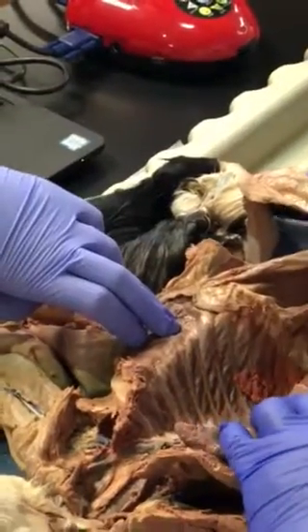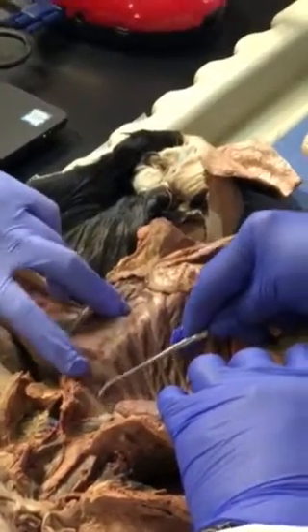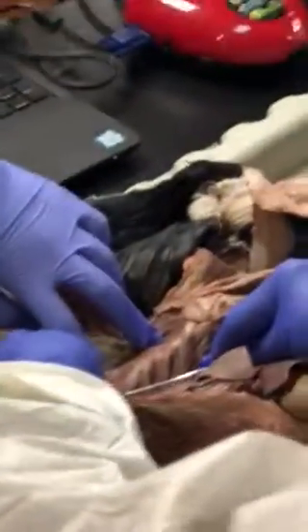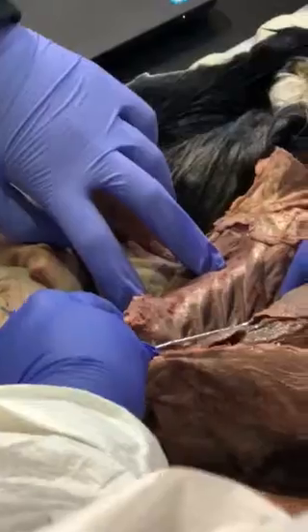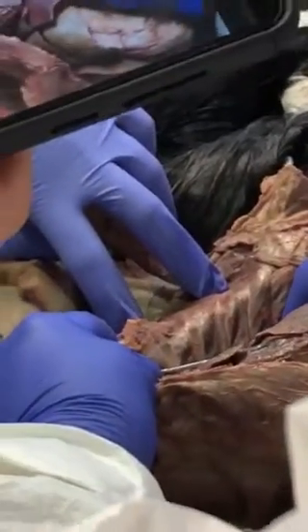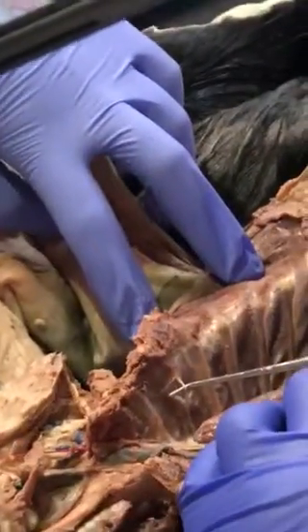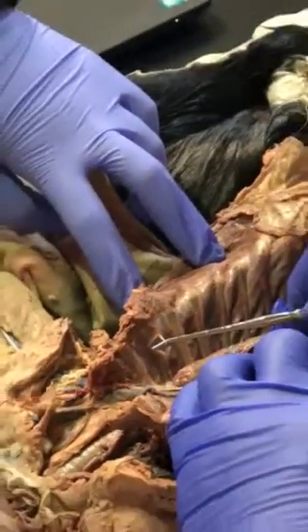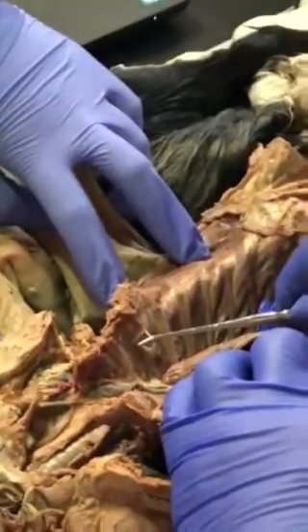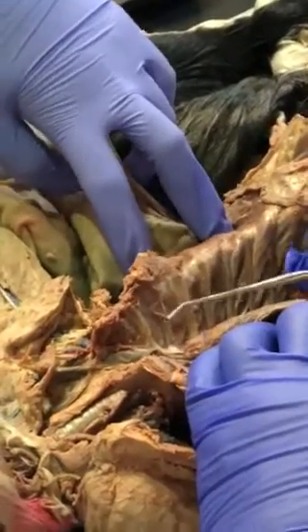Now, there will be a question here. You see this white thread-like structure here? What do you call that? It's not an artery, it's not a vein, so it's a nerve. So it should be the posterior intercostal nerve — it's in between.